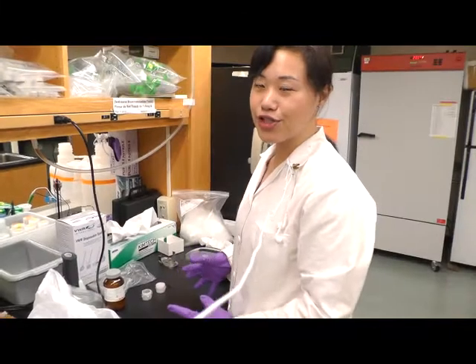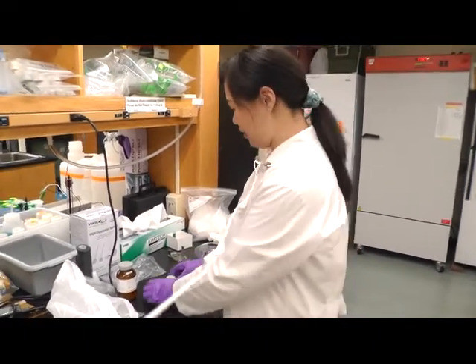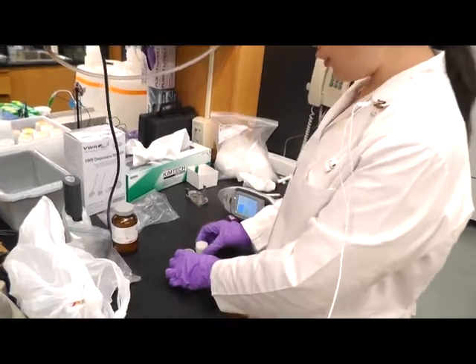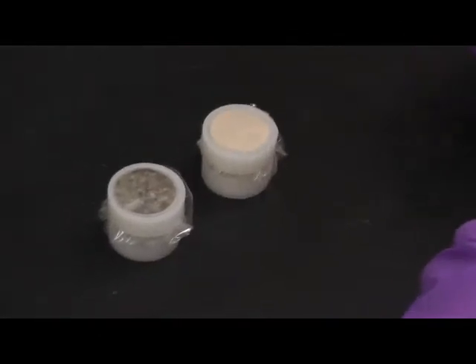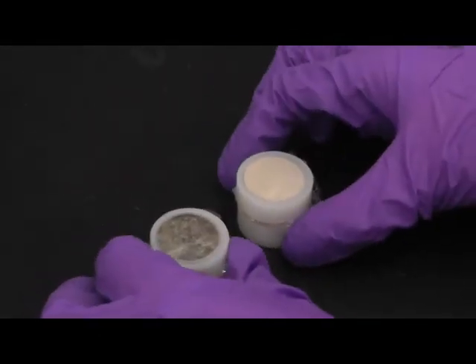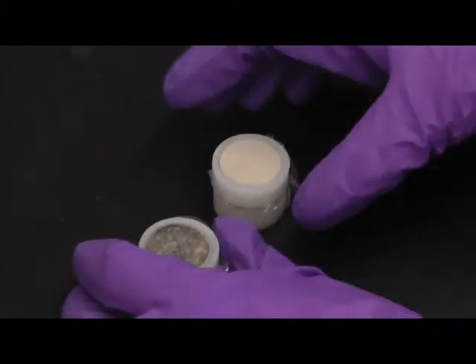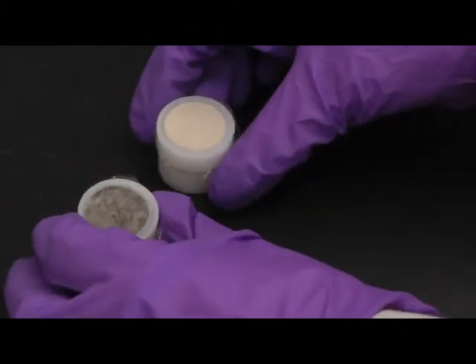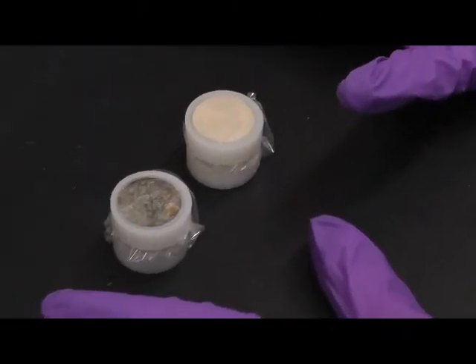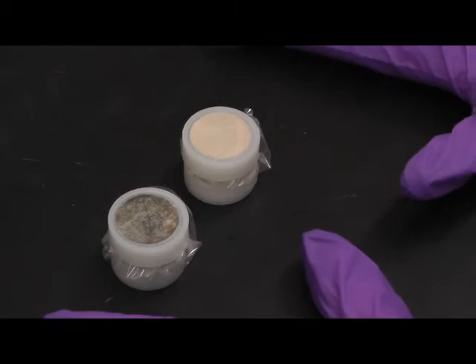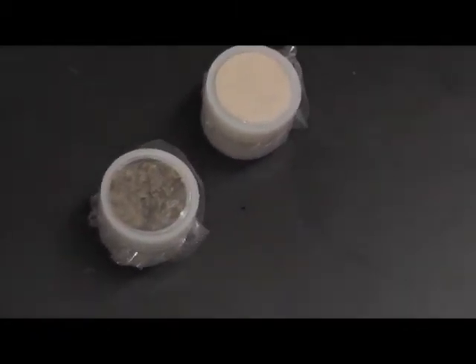Now we are going to show you how to make XRF measurements. We already have two cups: the dust cup and the soil XRF cup. And remember, when you store the samples, always have the transparent part up. Because this is the side that XRF instrument is going to measure. And any damage of the surface will cause measurement errors.